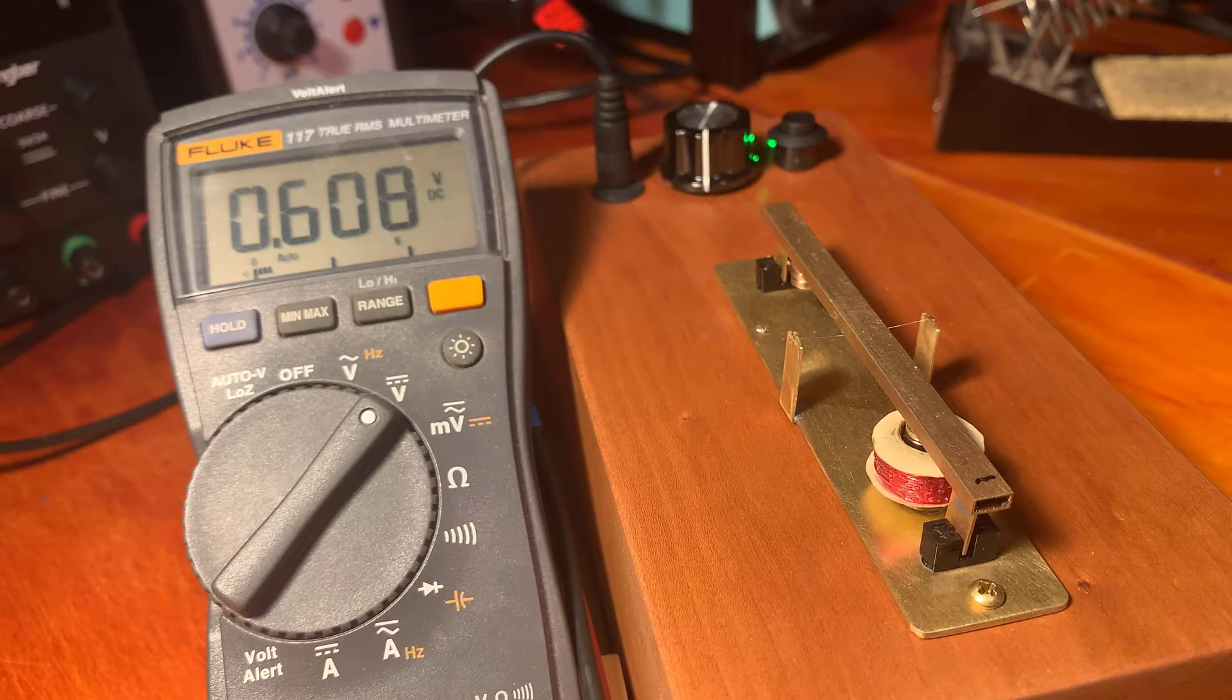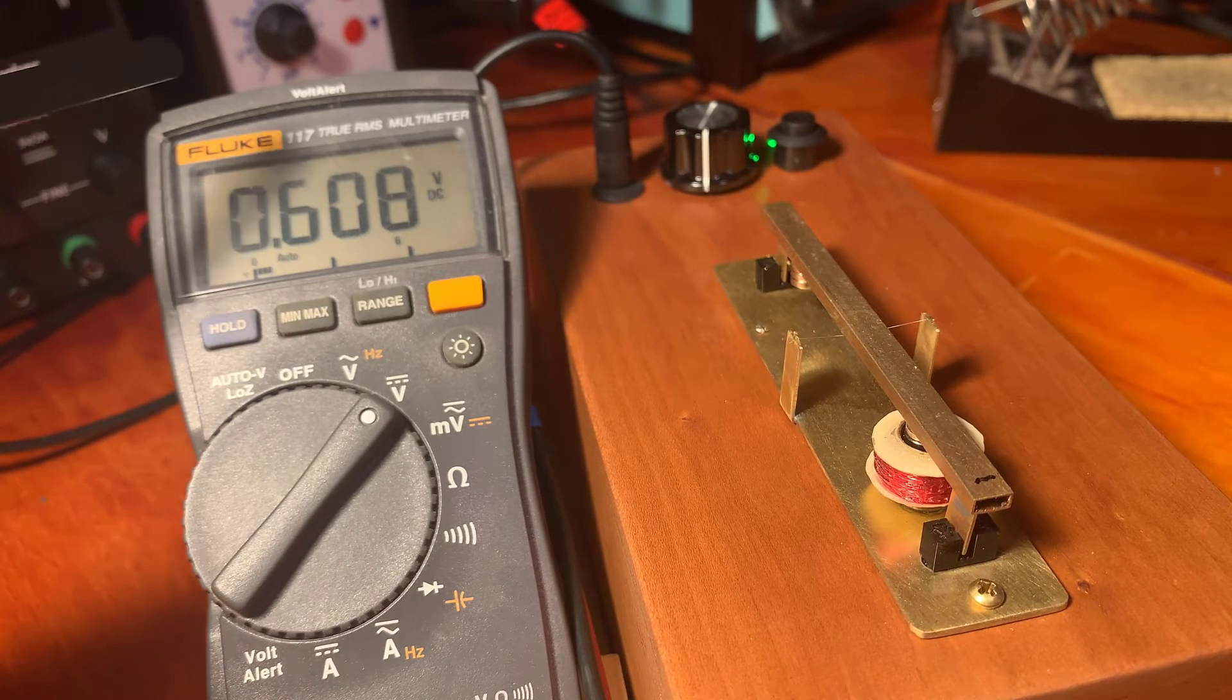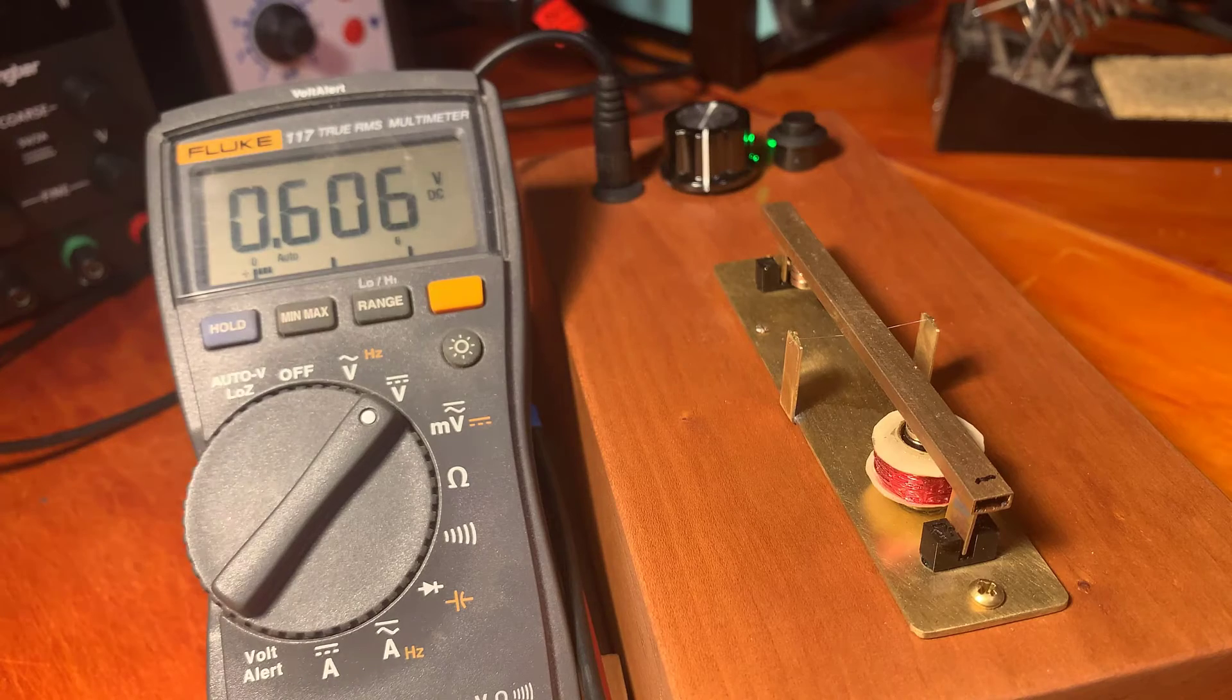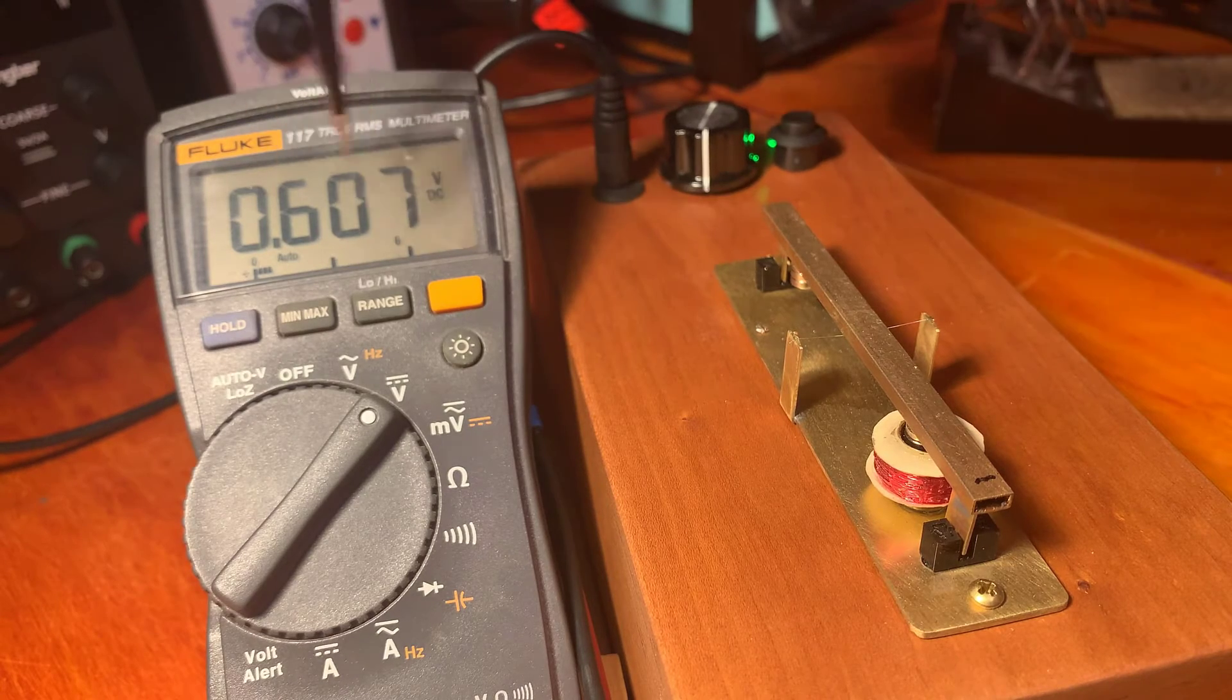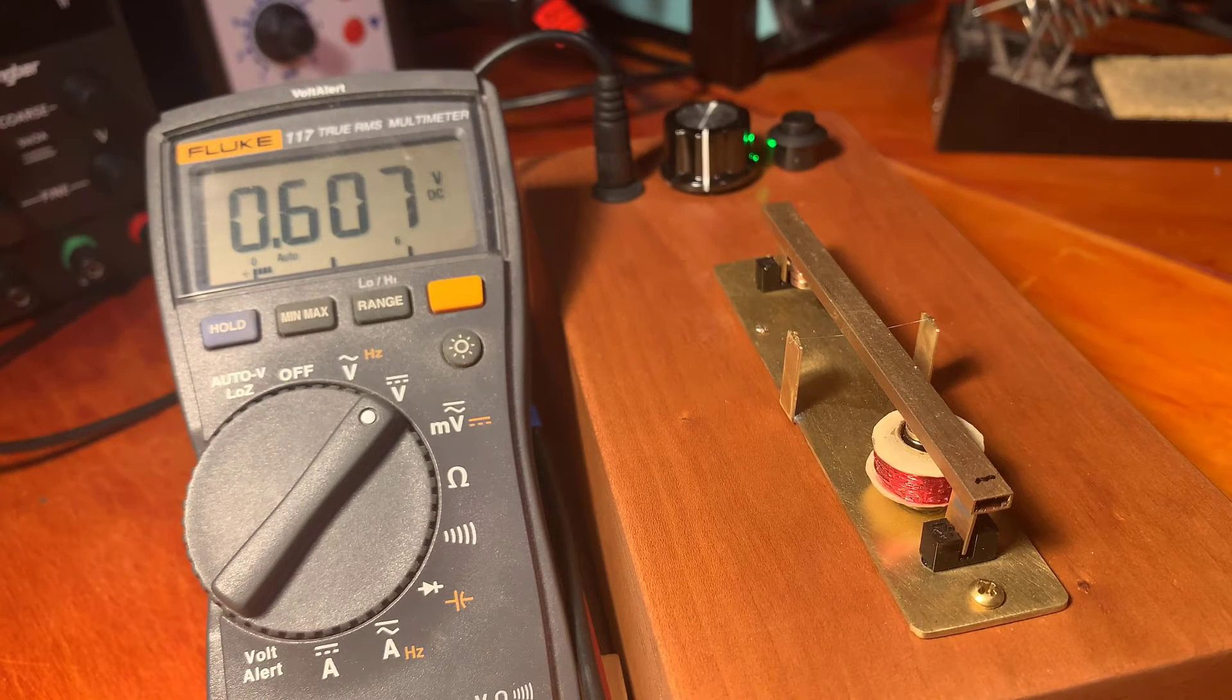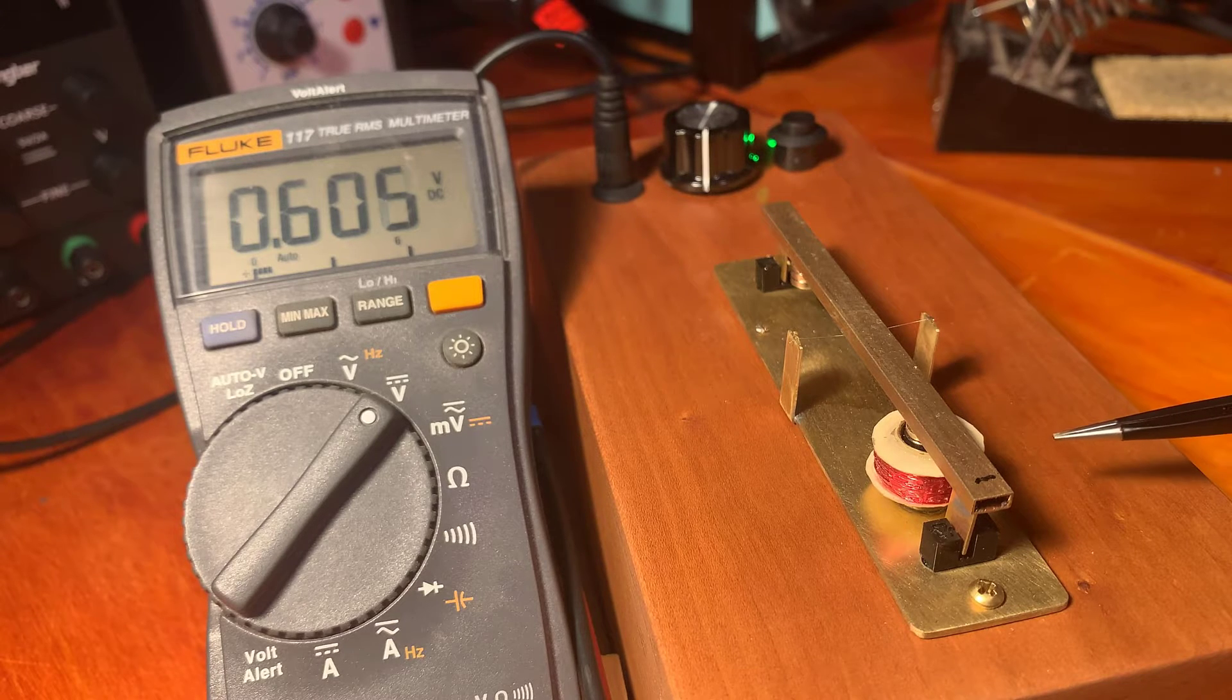So here's the microbalance. It just uses a standard voltmeter. This is measuring basically the current that I'm placing through this coil.